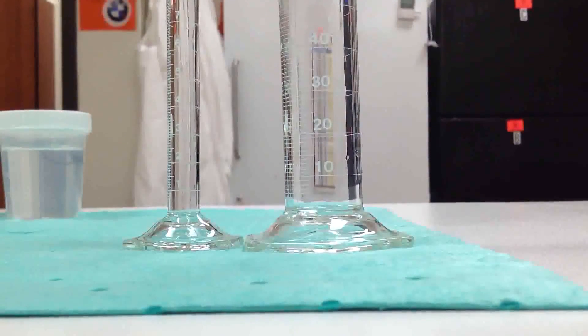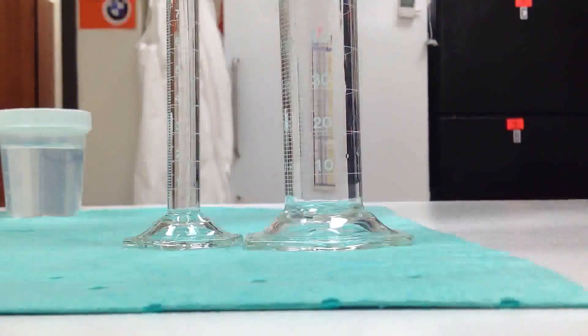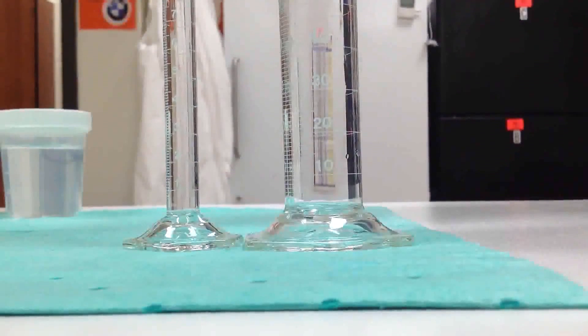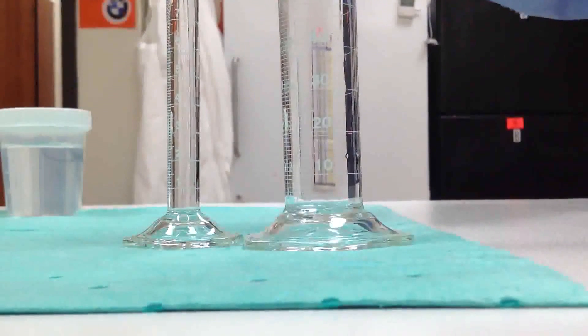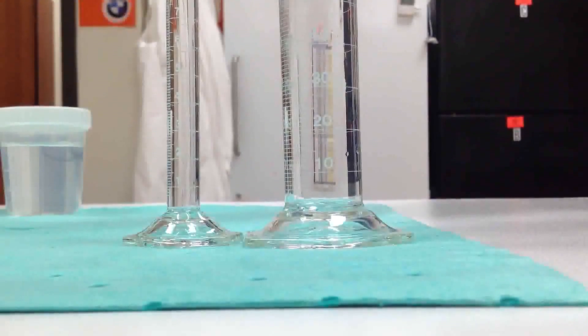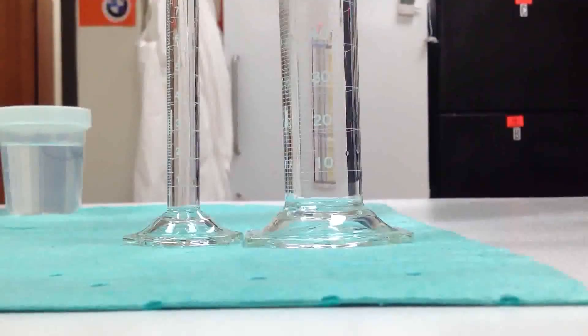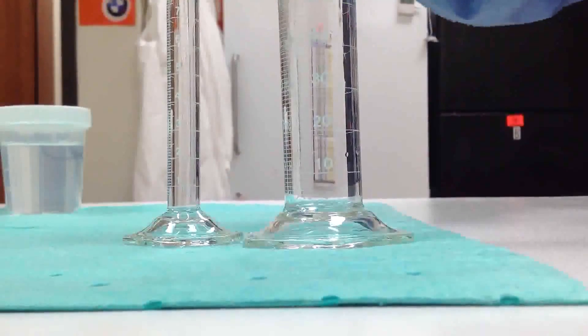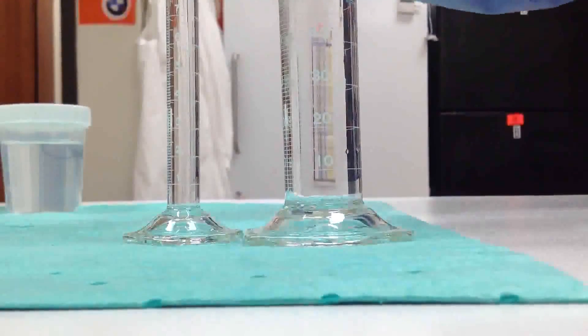We have two different sizes. We have a smaller one of 10 ml and the larger one of 100 ml. We need to measure 16 ml. So which cylinder will you be using? We're going to use the 100 because the 10 is too small.